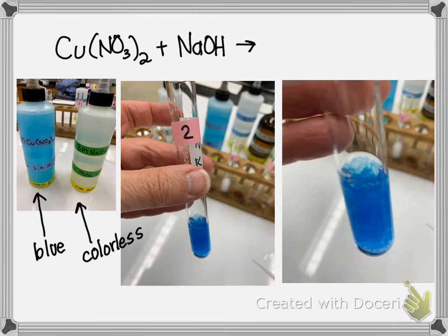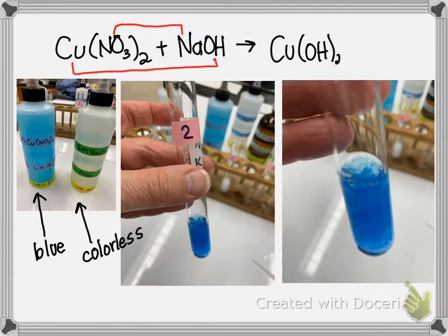And if we're thinking about what's happening, it's switching partners. So copper is going with hydroxide, and sodium is going with nitrate. So the copper with the hydroxide is a solid. And you can see it looks like a gel.